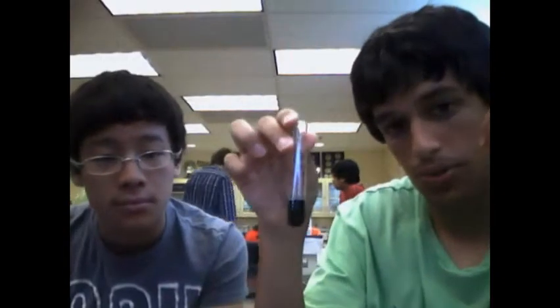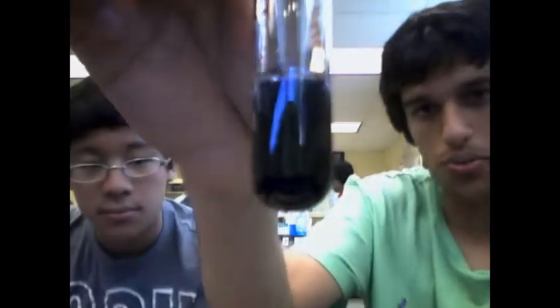So now we have 2. How much is this? 2 mils. We move along to test tube number 2, unknown substance number 2. As we can see, the colors are similar, almost actually the same. You should see something like this. You can see that this unknown substance number 2 contains starch.